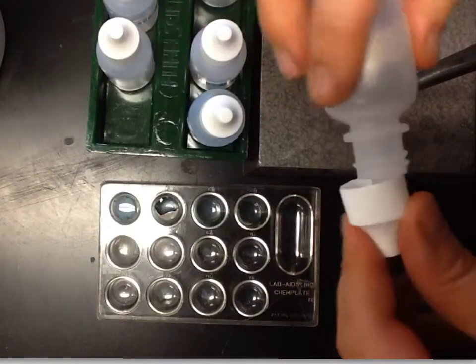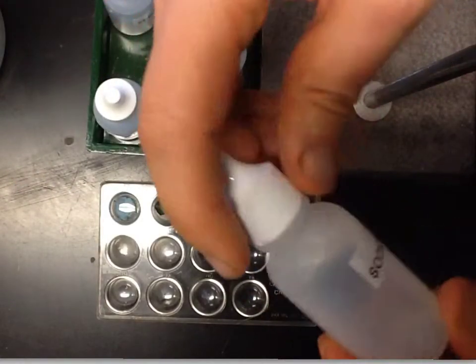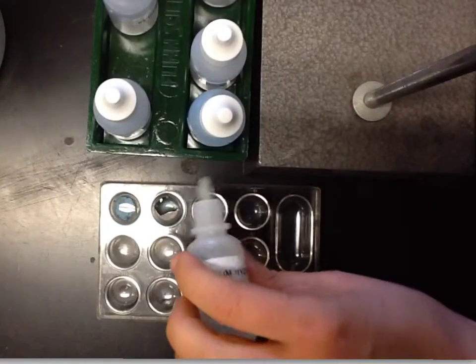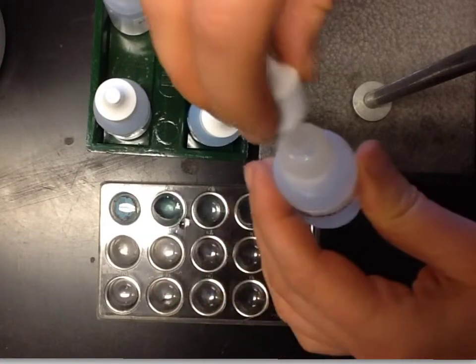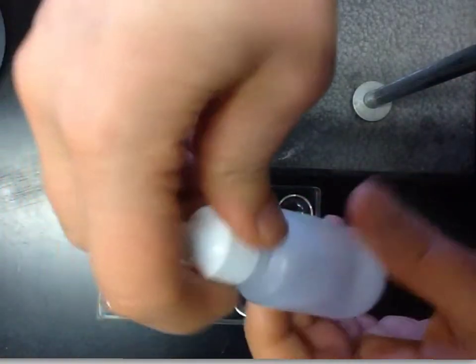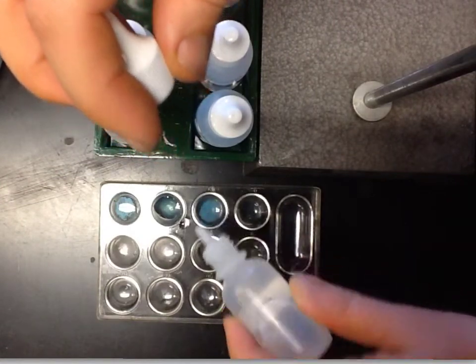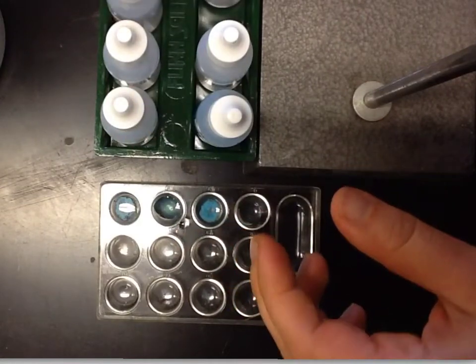And we can see there's a cloudy precipitate that forms. Next we're going to mix sodium hydroxide, again with that copper 2 sulfate from the first time. And again, you can see in that one it's not quite as white, but the solution got grainy. Now we have sodium carbonate being put into the copper 2 sulfate. Again, definitely this kind of cloudy milkiness is formed.